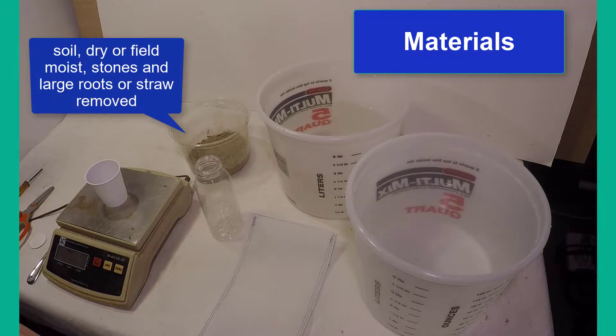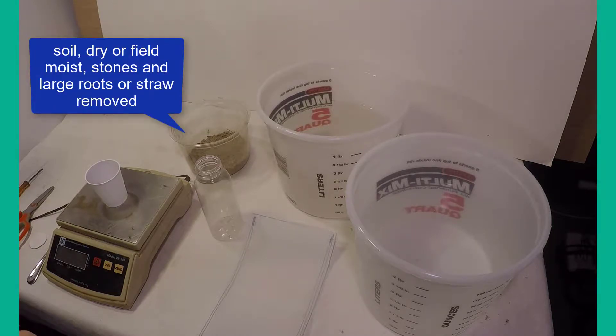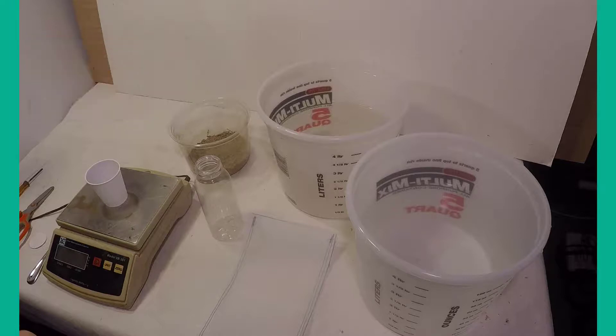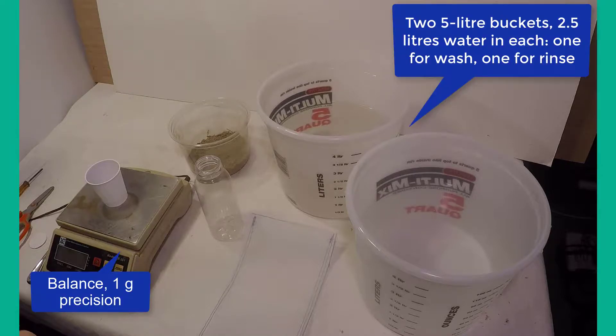To conduct this test, you will need a sample of soil, which is usually air-dried. Field moist soil will also work if you adjust for soil moisture at the end. A balance with one gram precision and two 5-liter buckets are also needed.